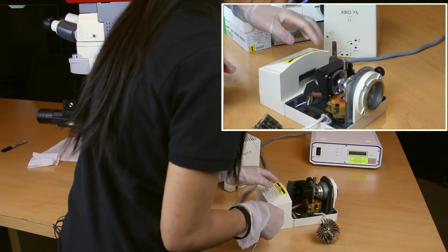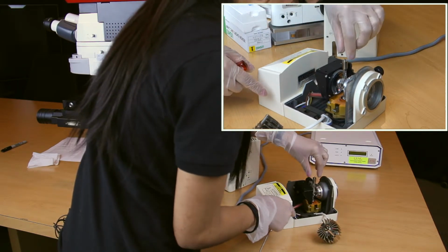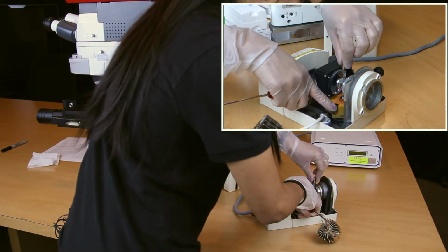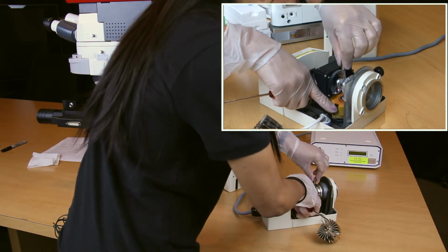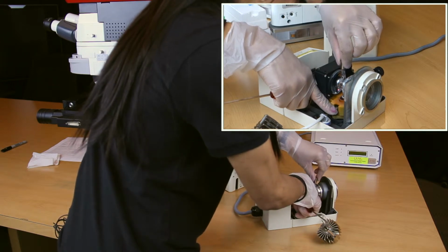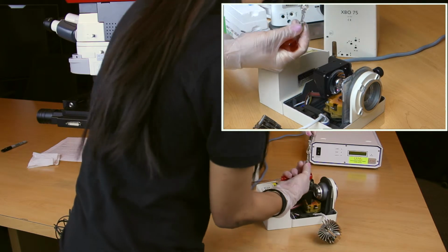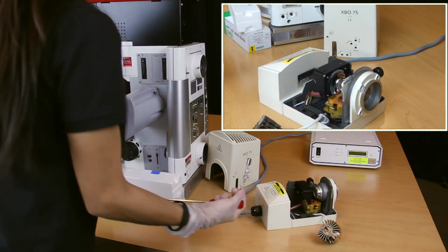Once the bulb is exposed, take one hand and hold the bulb, and with your opposite hand, push down the lever in order to loosen this from the socket. Once you press that down, hold it in a vertical position, and go ahead and set this aside and dispose of properly.